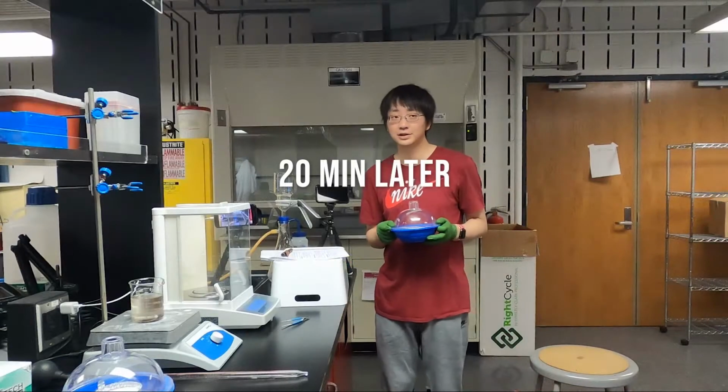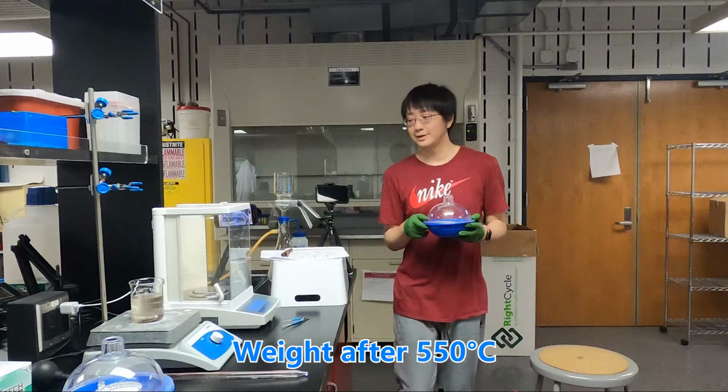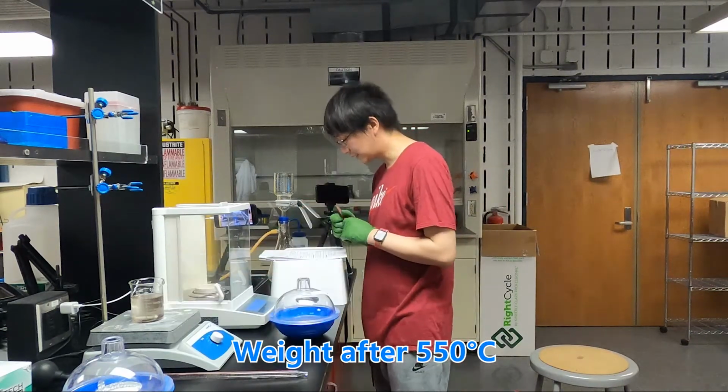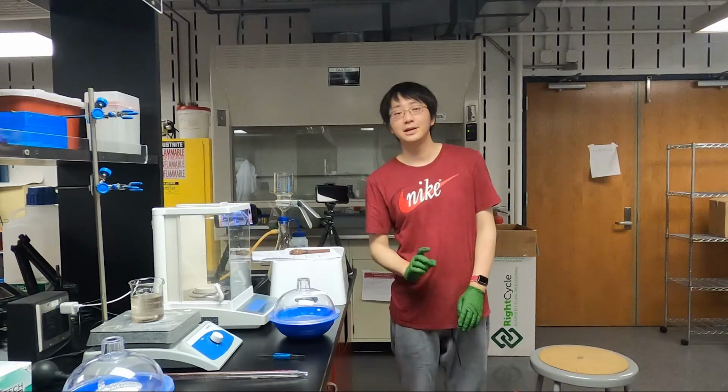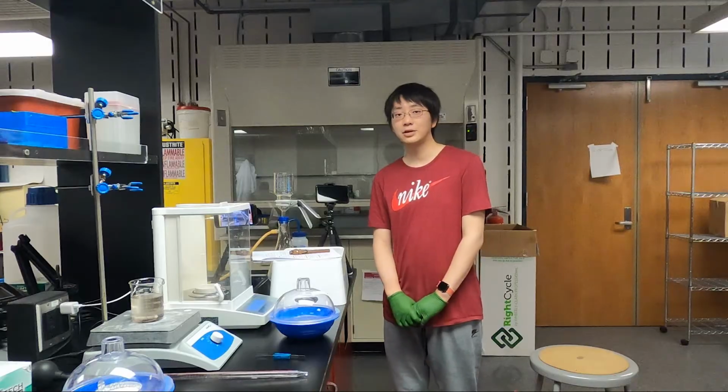And now it is after about 20 minutes, and then we are going to measure the weight of this dish, and write down the mass. And that's it for the dissolved solids. And next we are going to do the suspended solids.